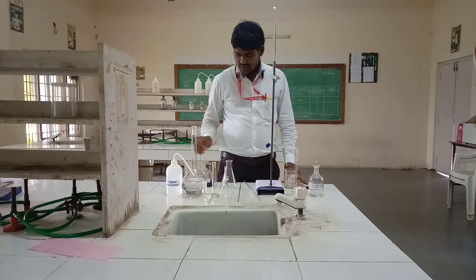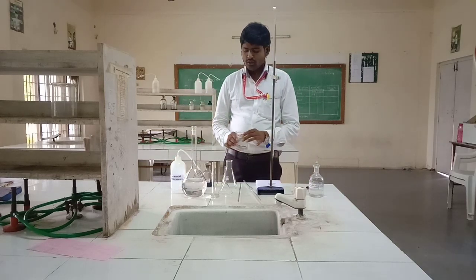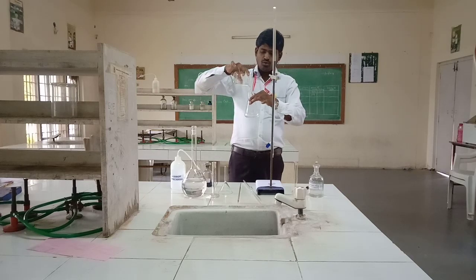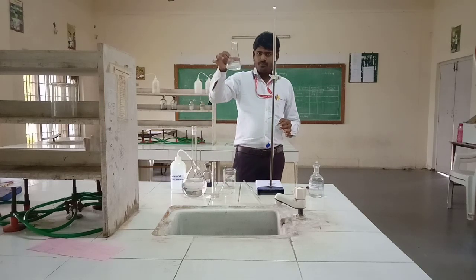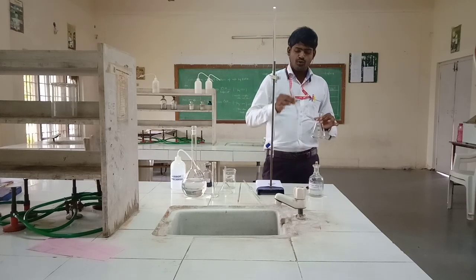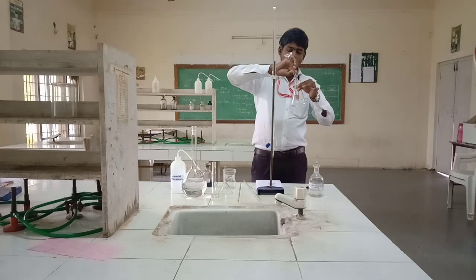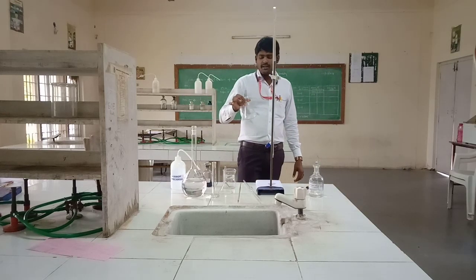Now the procedure. First, take a measured amount of hard water. We take 20 ml of hard water by using a measuring jar into the conical flask. This tap water is colorless. Then we add 2 ml buffer solution using the measuring jar, add it to the conical flask. Shake the solution for 3 to 4 seconds.